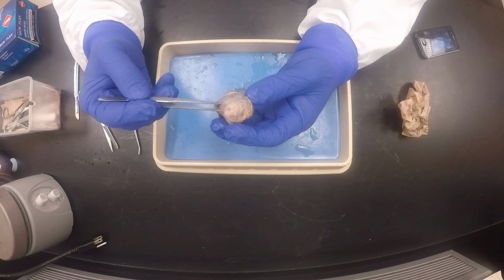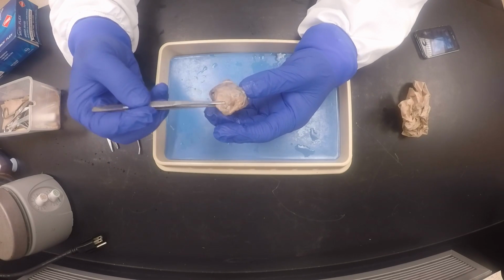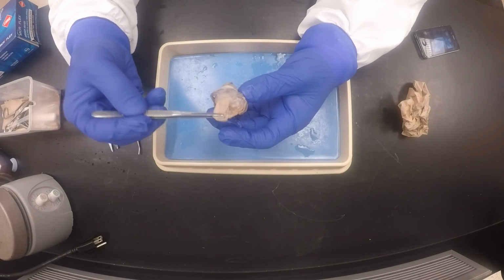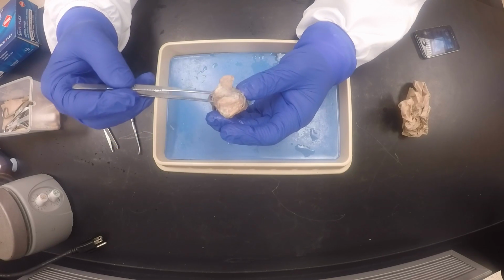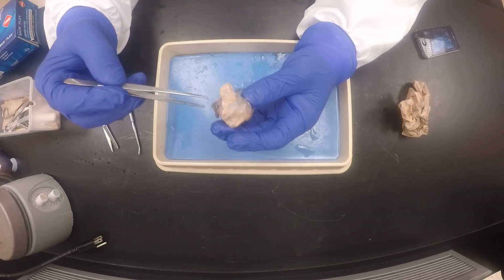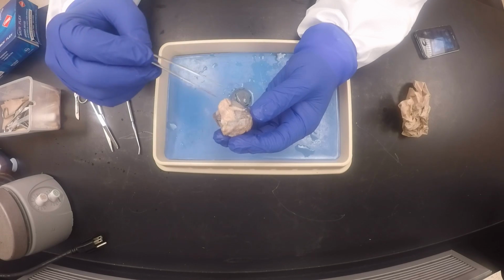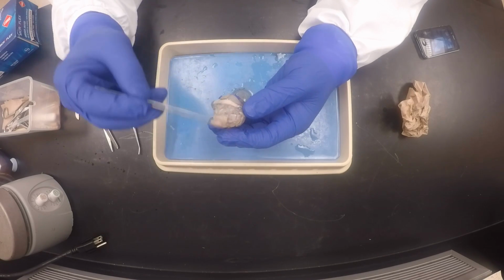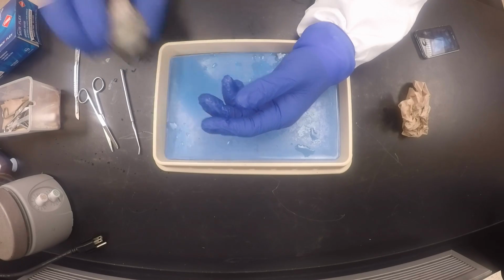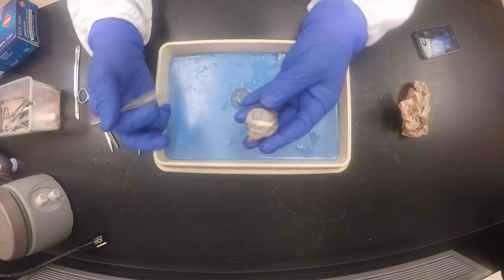You will confirm that indeed it is the superior side when you find 2 muscles there. One will be going straight out, which is the superior rectus, which is this, and one will be going at an angle, which is the superior oblique. You can confirm that indeed this is the superior, the top of the eye. So this would be the right eye. It's the right eye because this is the lateral side. You can tell.